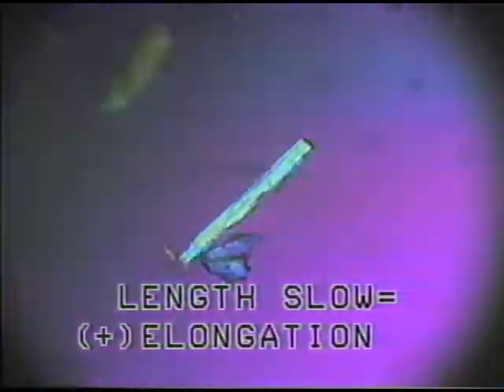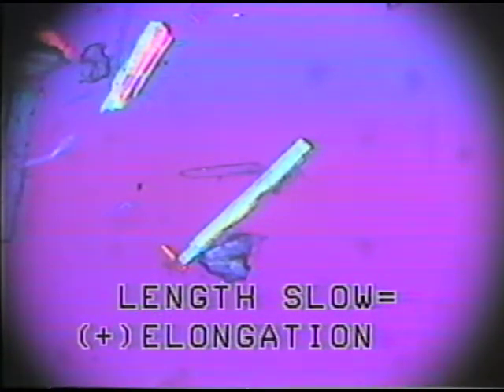This means that the mineral has, by convention, what we call positive elongation. Positive elongation, or else we might say that the mineral is length slow. Okay? Now the opposite sort of situation I can show you in another mineral grain.